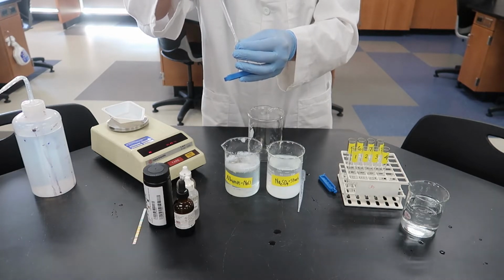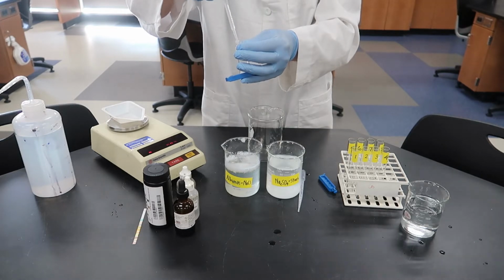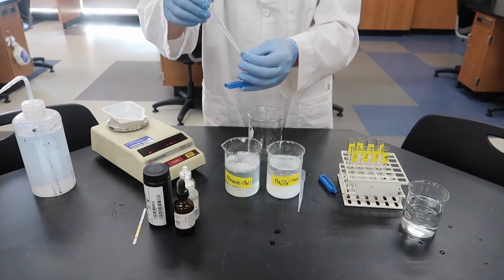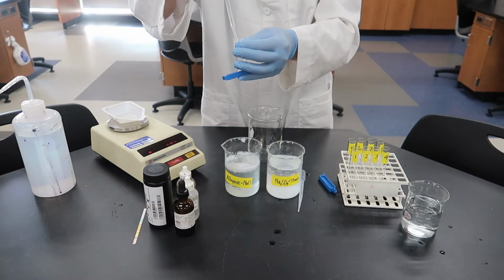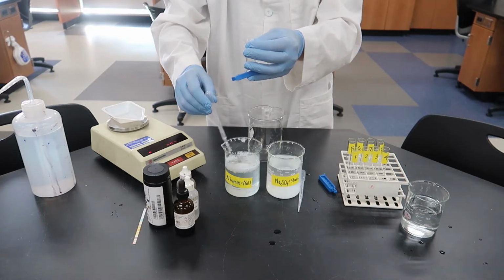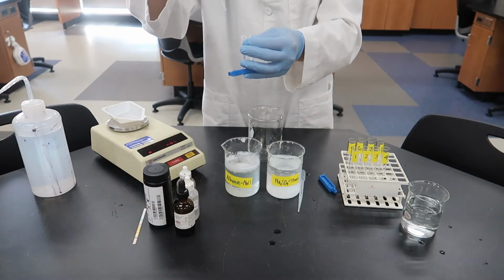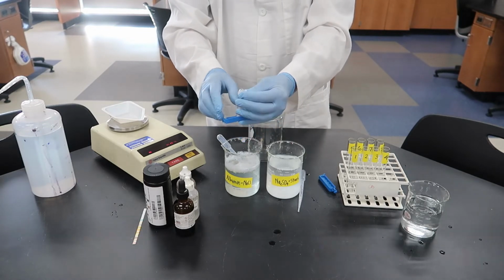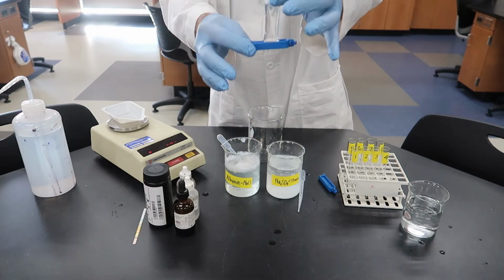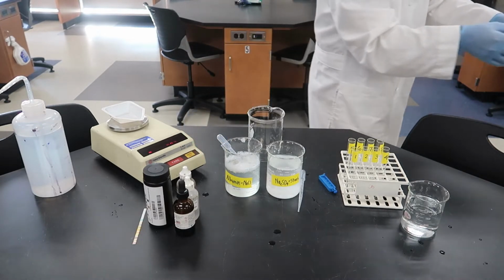Okay, I've almost got it filled up. You can see it's kind of tricky to get that liquid in, and I'm dribbling a little bit as I'm trying to get it into that opening at the top of the bag. It's almost full. Okay, now we're ready to clamp off the other side. Okay, you can see it's pretty plump and holding our albumin NaCl mixture.